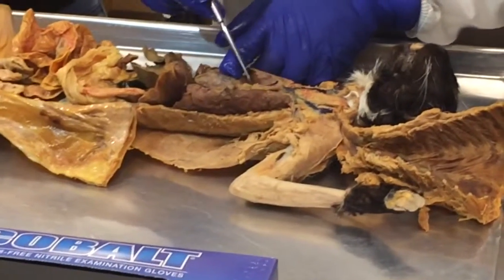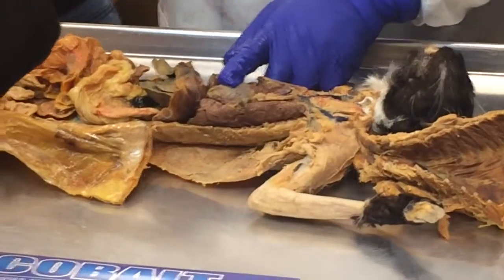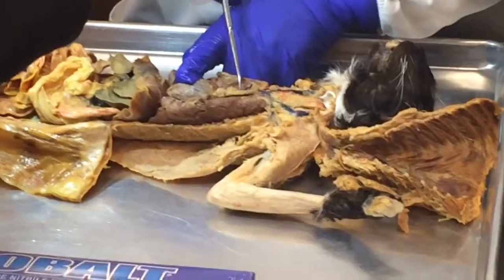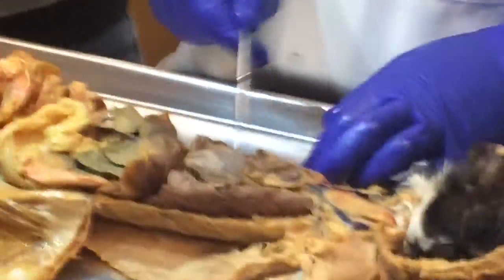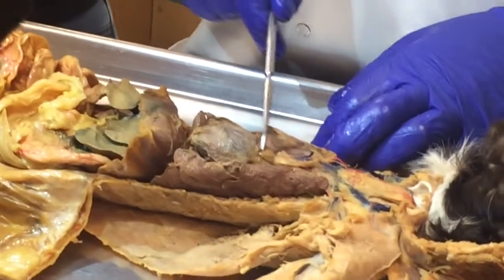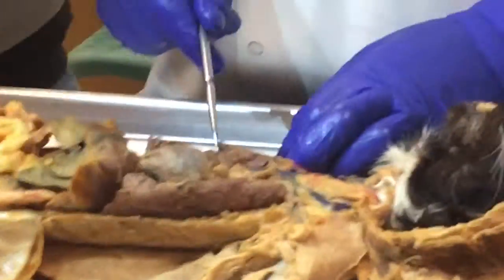And oh my god, did I remove some of it? But this will be part of what I was calling the thymus that time that you were asking about, Olivia. The thymus would be here, and some of it is mostly fat over here, but the other cat that I normally use for you, the thymus is still really nice and present because it's a younger cat, you know what I'm saying.